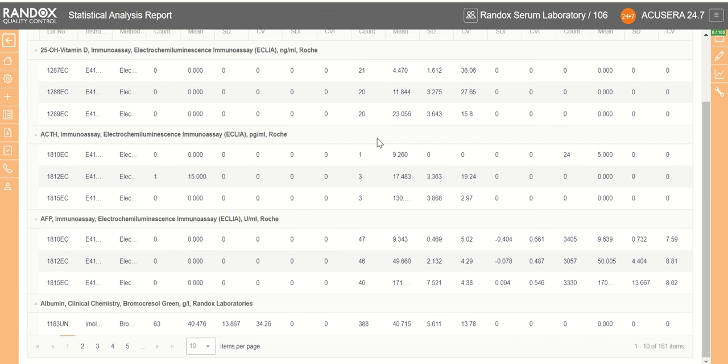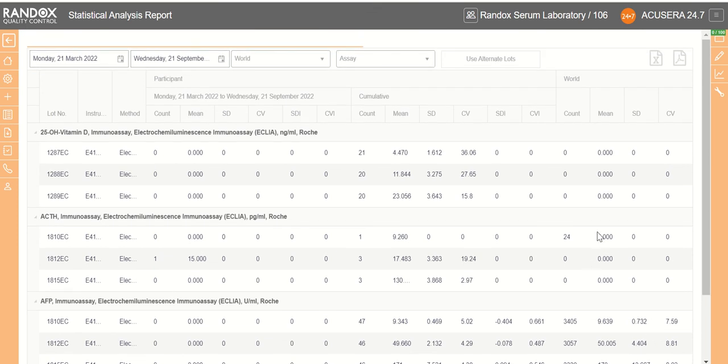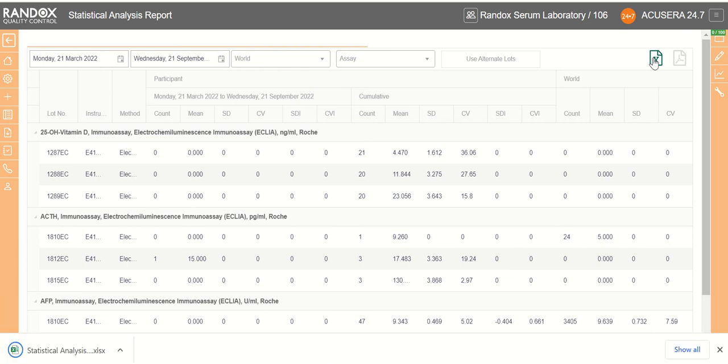because we have no peer group for this very specific QC test. However, if we scroll down, we can see for AFP, we have not used this QC test over that date range. We have no results added. However, we do have cumulative results with our count, our mean, our SD, our CV, our SDI, our CVI, and our comparison against our peer group, where they have 3,405 results, a mean of 9.639, an SD of 0.732, and a CV of 7.59. So we can see that on lot number 1810 EC, we have overperformed compared to our peers. If you wish to download this, we can simply click on our X for our Excel format.